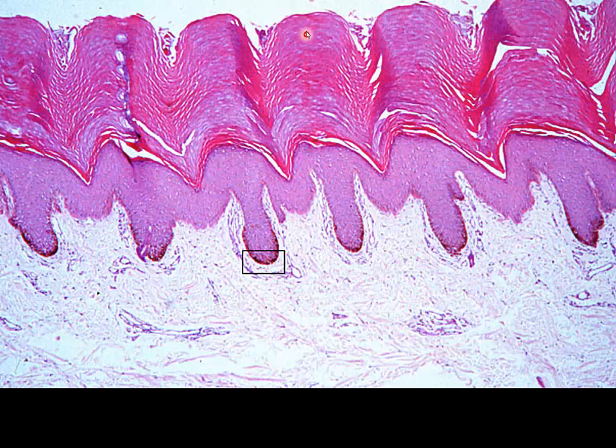Here we can see our thick skin, our stratum corneum, extending from here all the way down. There are dermatoglyphs that we see, duct of a sweat gland. We have our stratum lucidum that's going to be in this case. Now, it's difficult to see because we have artificial separation in that region, but we also have this darker layer that you see here, sort of in the purple. That's our granulosal layer, spinosal layer.